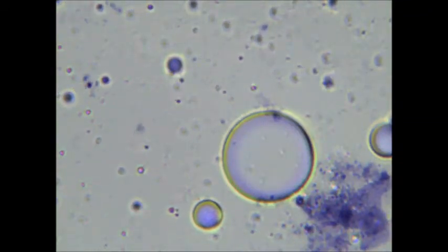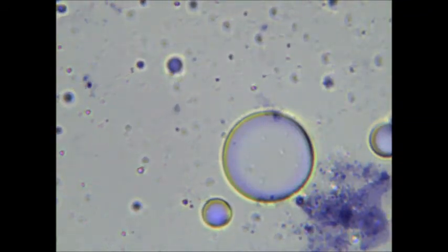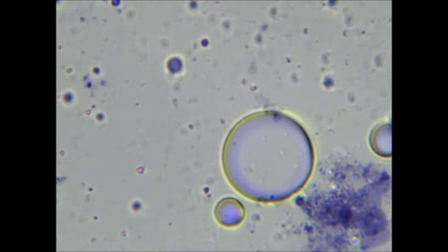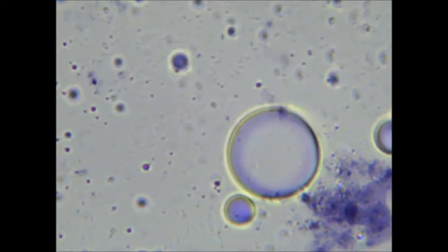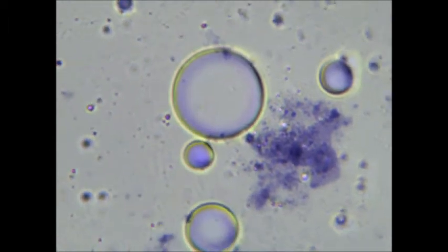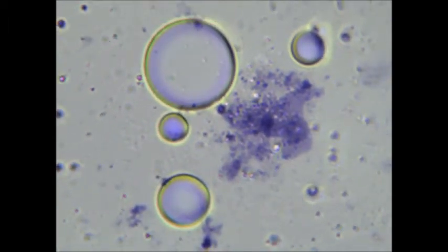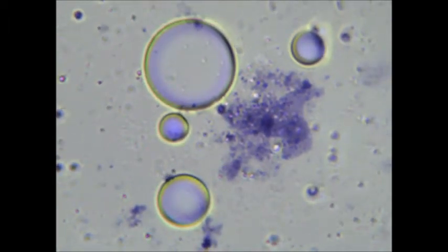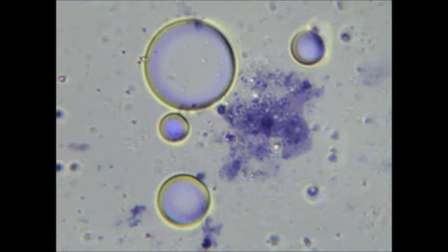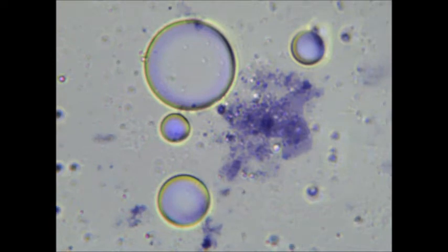Hello YouTube, MadScientist72 here back with another video. This is a video of a fatty acid vesicle mixed with ribonucleic acid bases and hematoxylin stain. I did this experiment to see if I could get the RNA bases to enter the fatty acid vesicle.